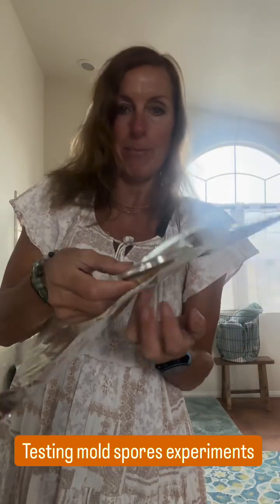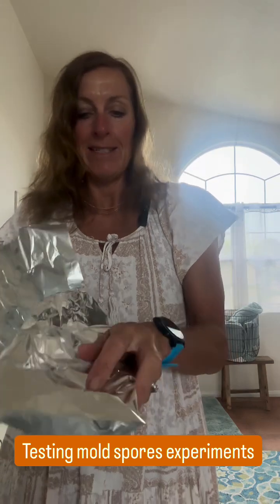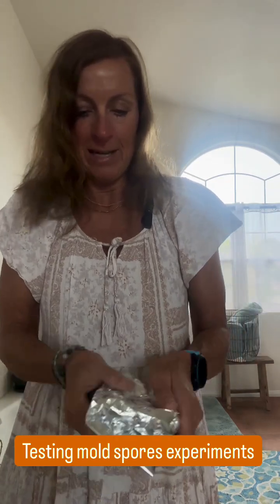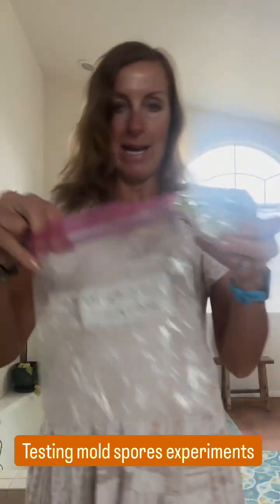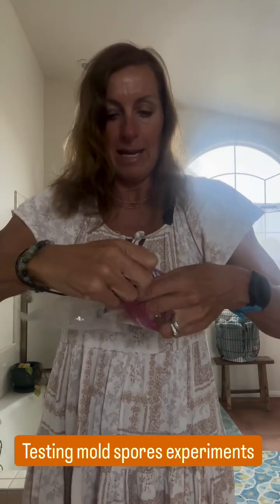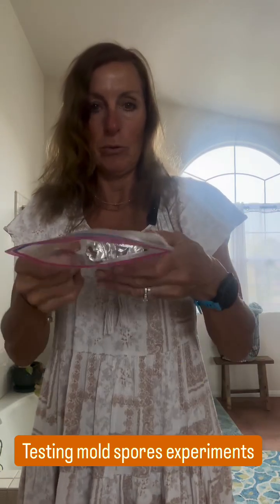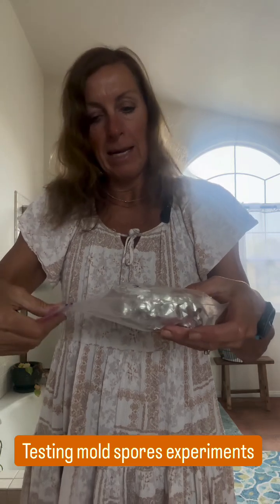It says to wrap in foil — foil is bad to wrap on your food, but this is okay. So I'm wrapping it up, putting it to sleep, and then placing it in a plastic bag to keep it out of light. I wrote 'master bathroom' and the date on the plastic bag.